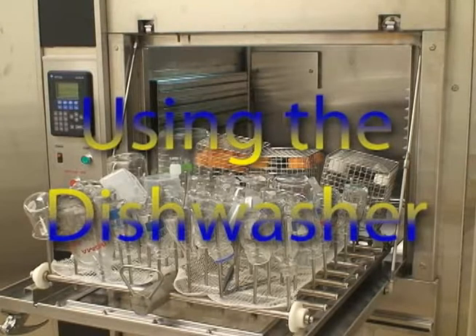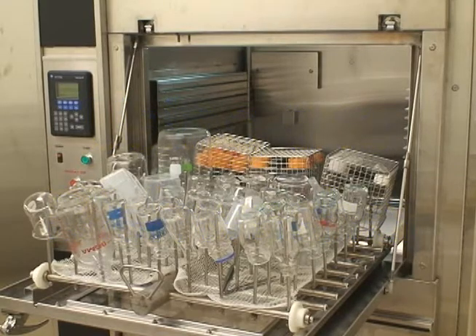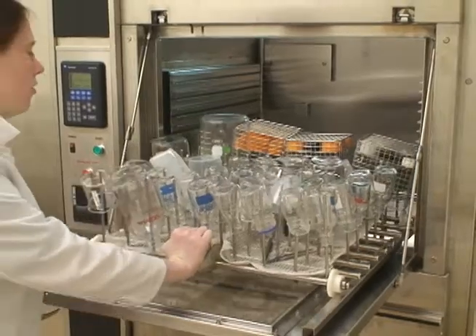This is the size of a typical load for this dishwasher. Just one quick tip: plastic materials should go near the middle, especially if they're small. Also, you don't put the soap in before it starts.